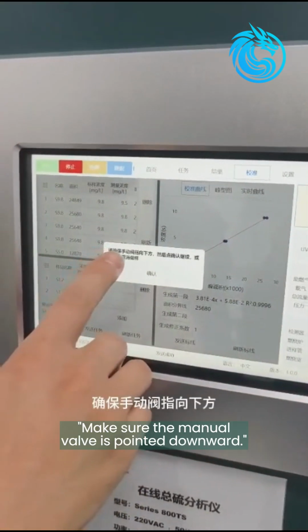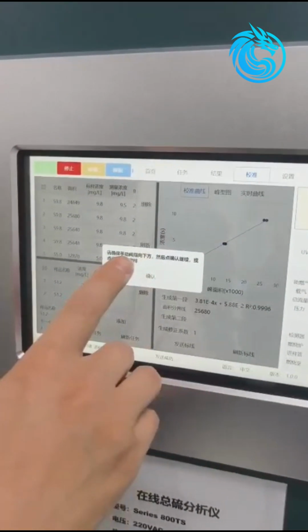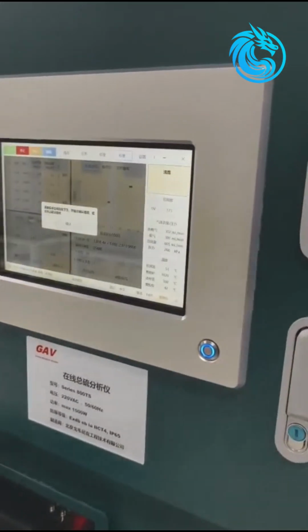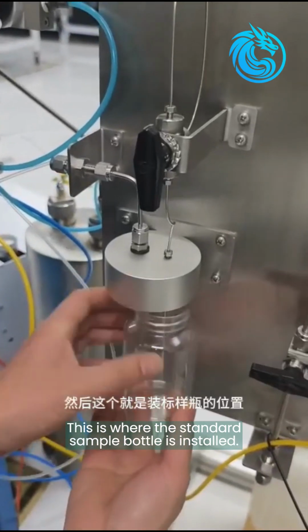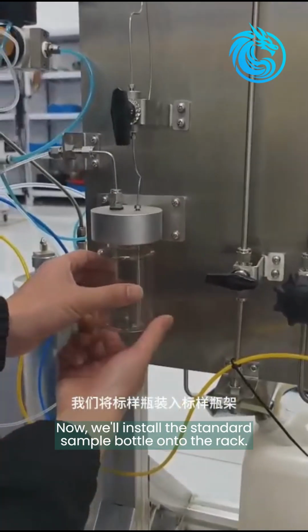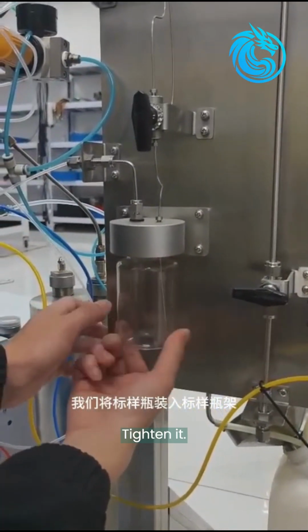Make sure the manual valve is pointed downward. Click Confirm. Let's prepare the standard sample first. This is where the standard sample bottle is installed. Now, we'll install the standard sample bottle onto the rack. Tighten it.